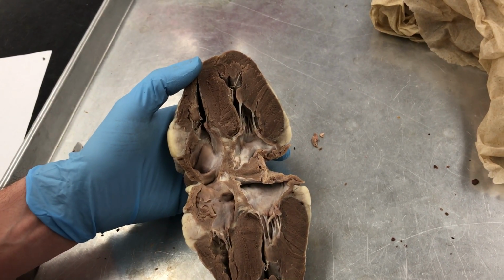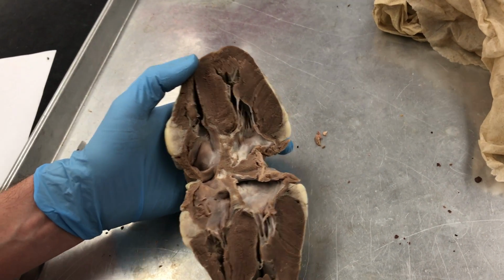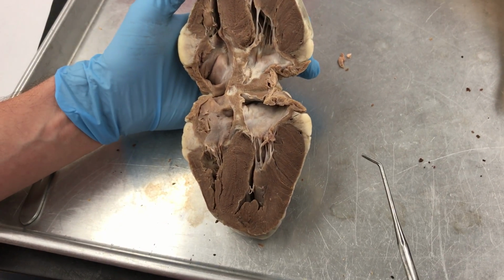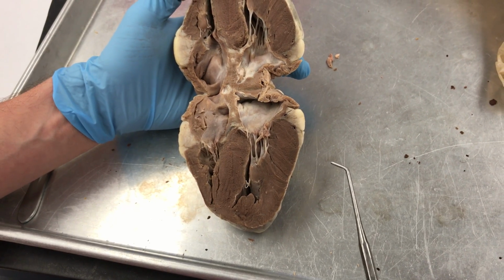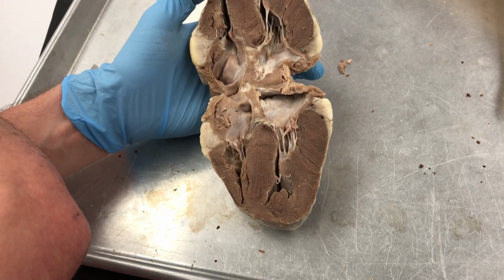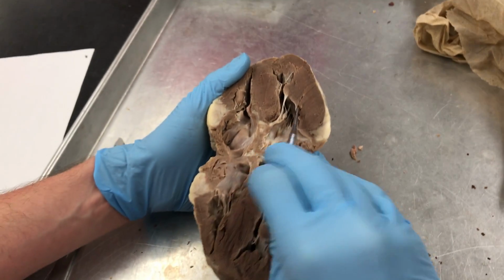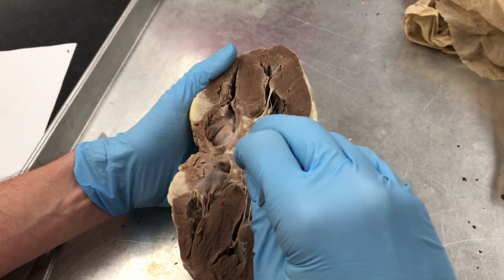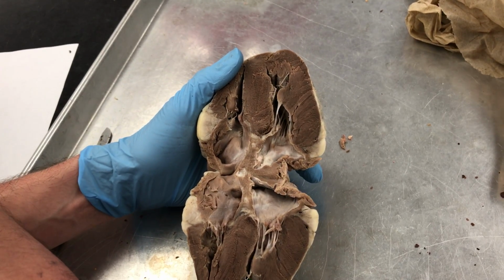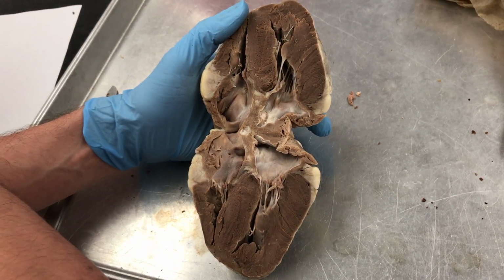Don't worry about the coronary artery, the vena cava we got. Interventricular septum. Must be between the ventricles. Alright. Papillary muscle. I think that's just these muscle bands in here. The semilunar valves we didn't see because you had to cut into it more.